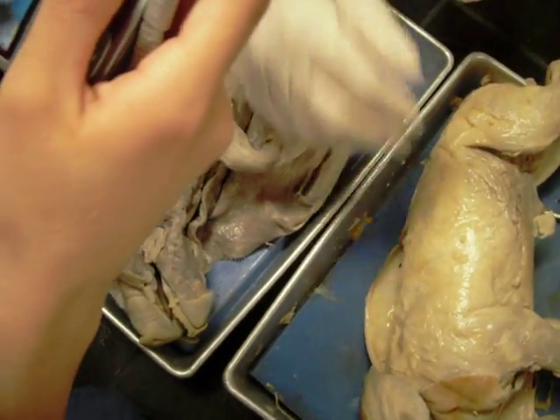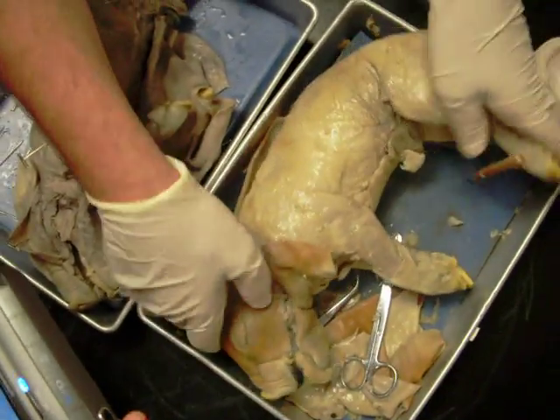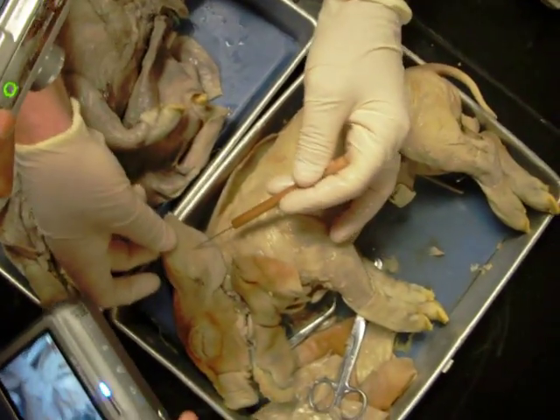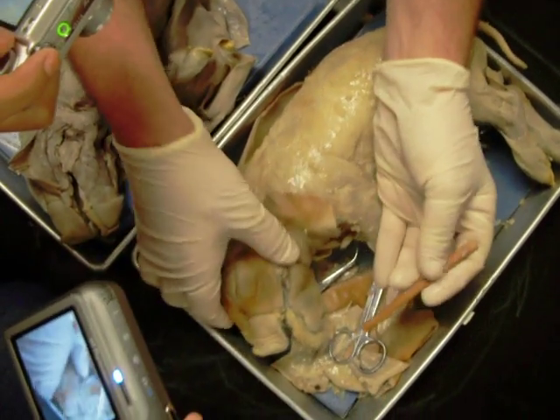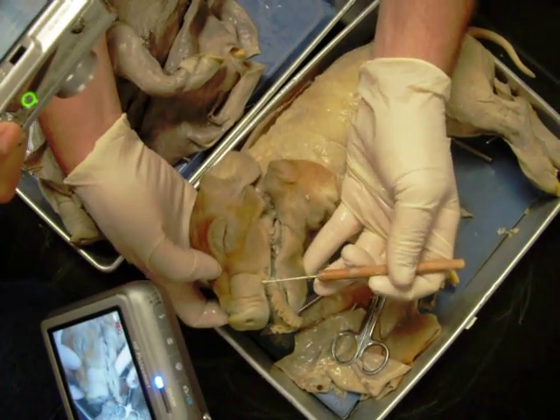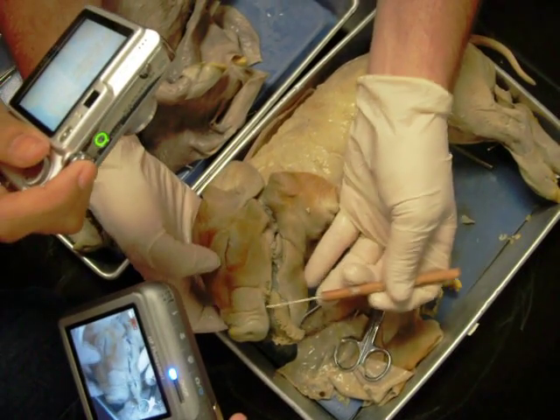We're going to start anterior and external and see some of the external features. I'm going to use this one because it's prettier. There's the pinna, and here's the nostril. And then these little whiskers are called vibrissae.